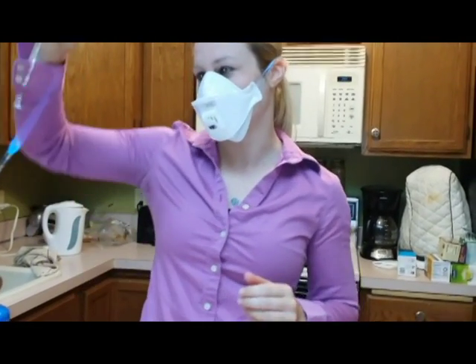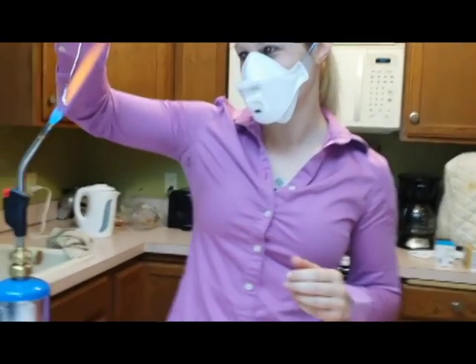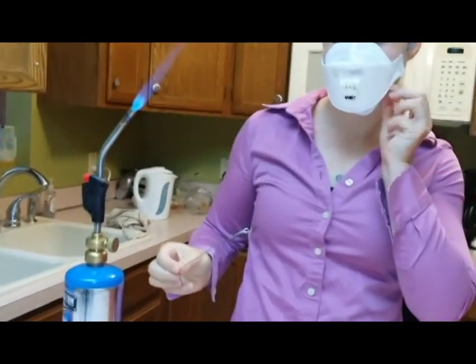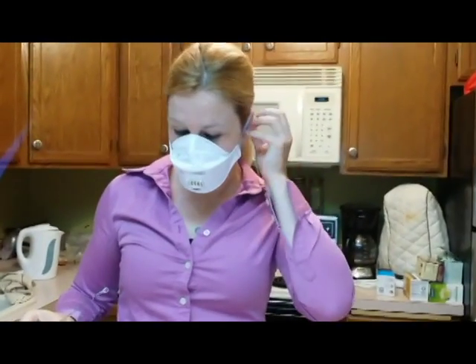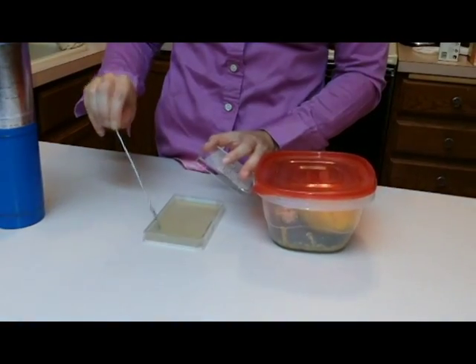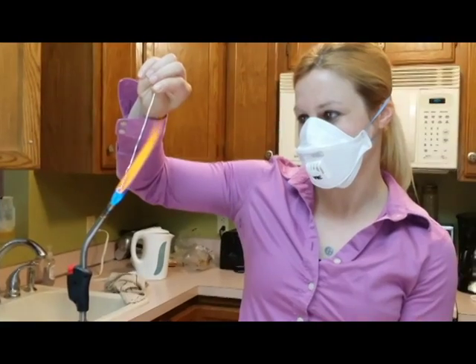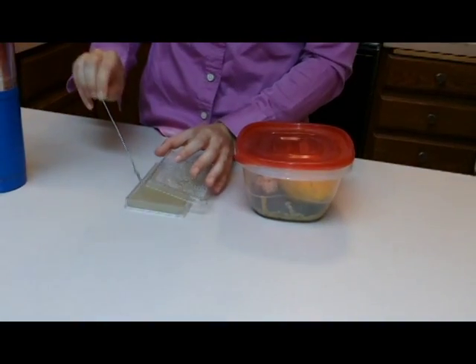One more. Clean your loop. Touch it to the surface one more time. It's good to be extra careful with this. To the surface, you hear that nice hiss.